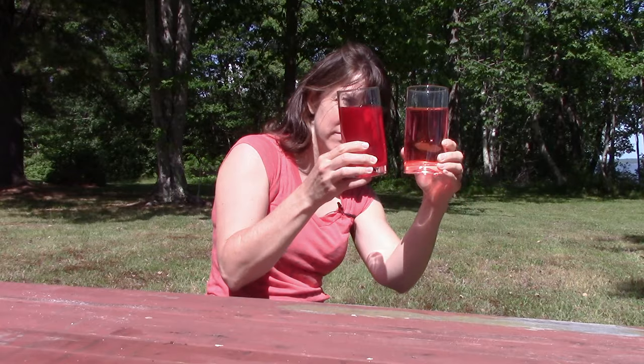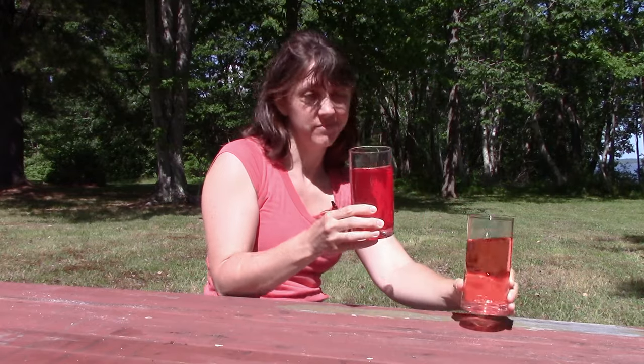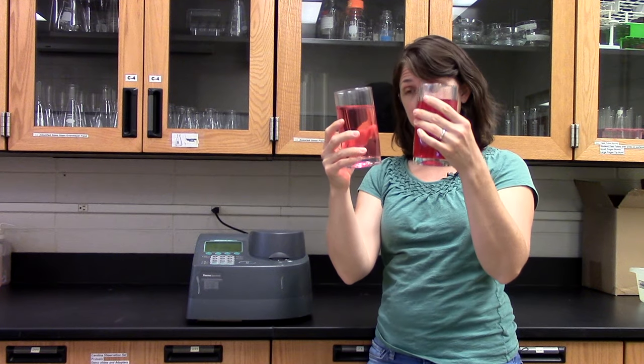I have here two glasses of Kool-Aid. One of them is more concentrated than the other. Can you tell which one? This one — it's darker. What you just did with your eyes is essentially what the spectrophotometer does. When you looked at the glasses, the Kool-Aid particles in the darker glass absorb more light. That's why it looked darker.